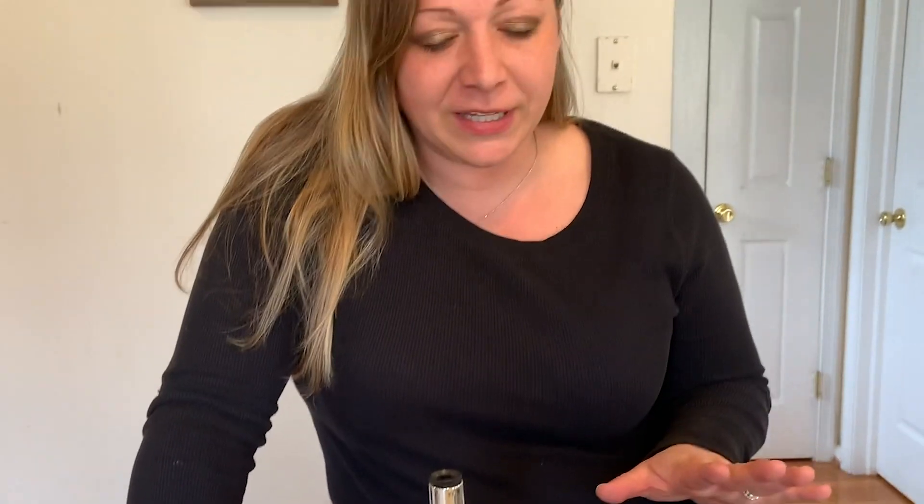Today, we're going to be using my home microscope to see what we can see under the microscope. Now, don't worry if you don't have a home microscope — that's completely okay, because I'm going to be able to take pictures of what I see through the lens here.